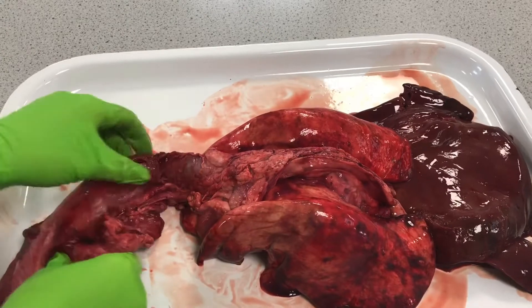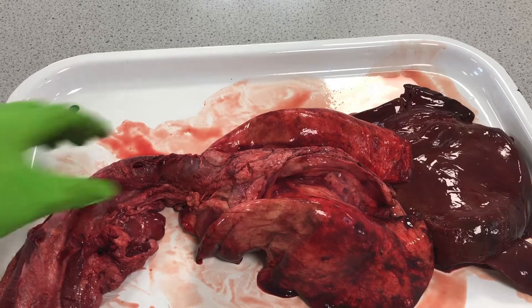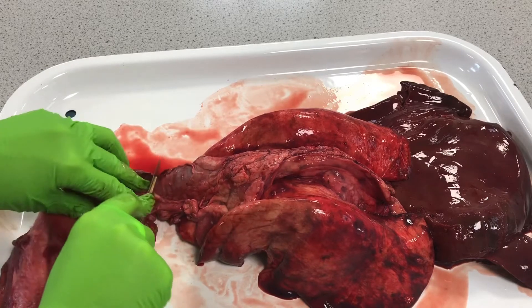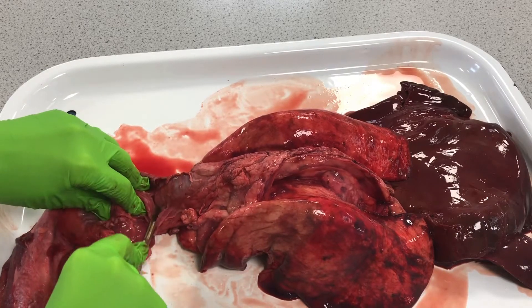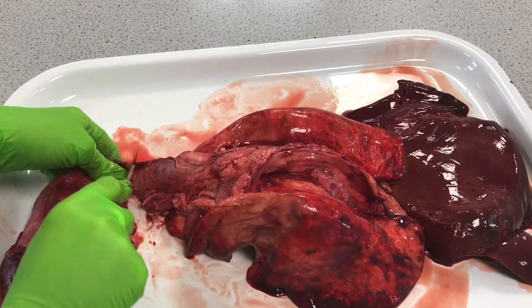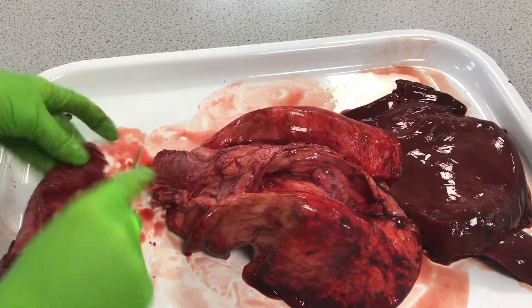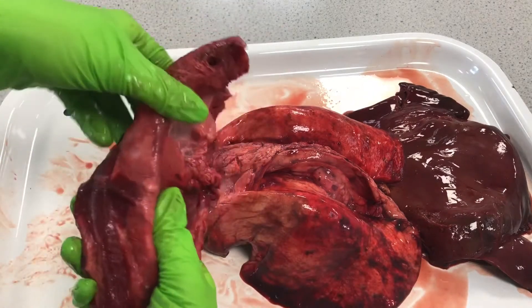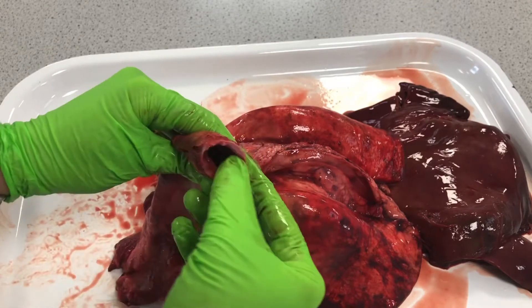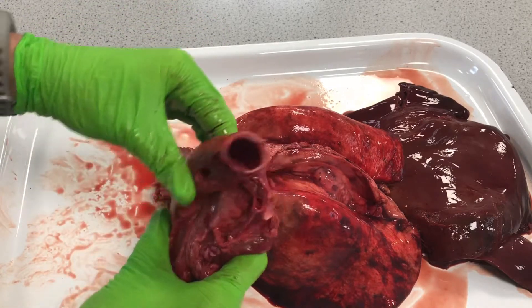Now what we're going to do is actually cut through this trachea to show you the cartilage — and actually it's quite broken here, so that'll probably be better for the next stage. We've cut that part, and we can see the trachea held open with these rings of cartilage, which keep that tube nice and rigid and open.